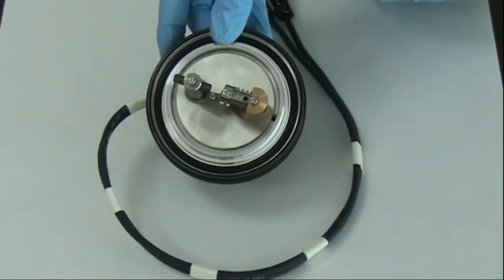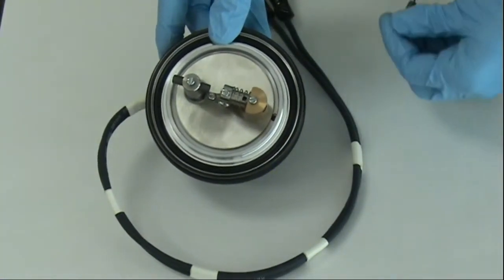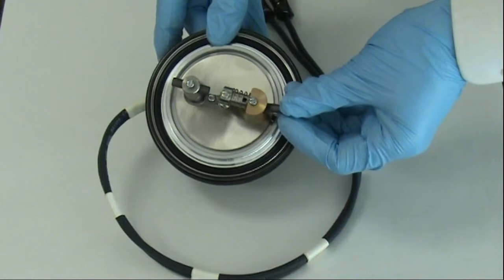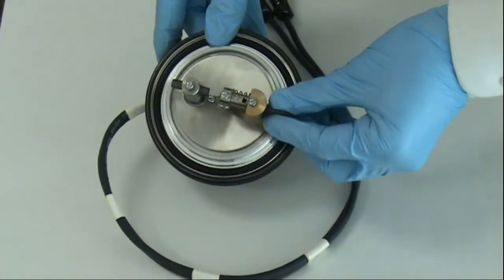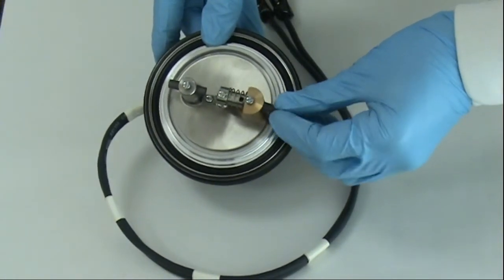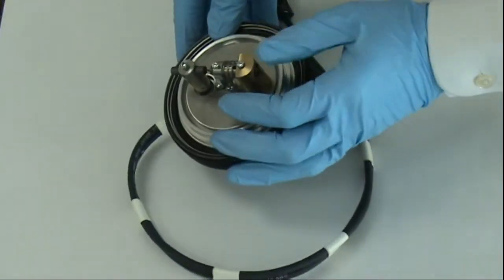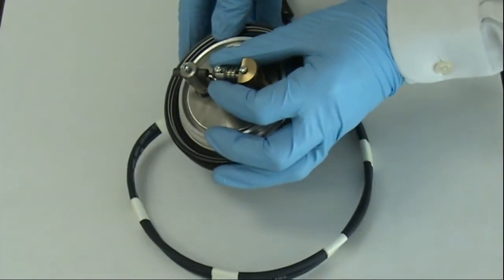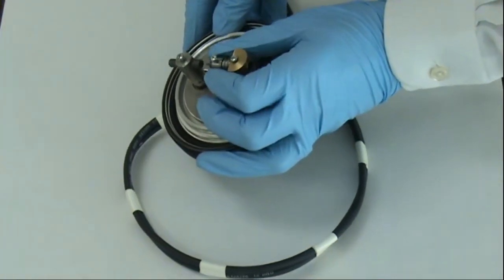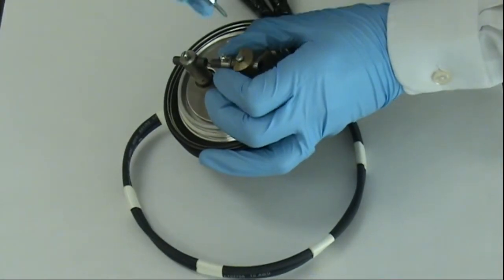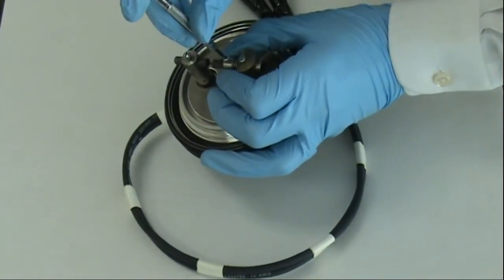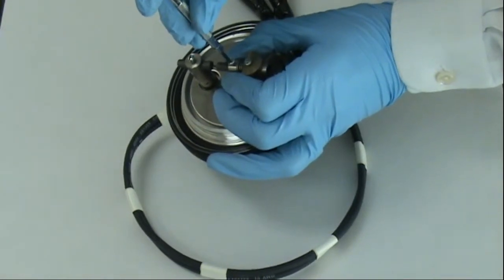Mounting the rod is done by sliding the fresh rod into the sleeve and pushing up against the flat on the fixed rod. While this position is held, the spring is pushed back and the standard screw tightened onto the rod. In this way, the rod is now set up so that it will continue to feed the fixed rod as the evaporation process is done.